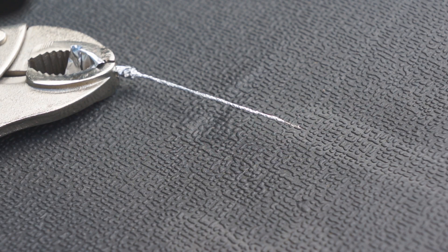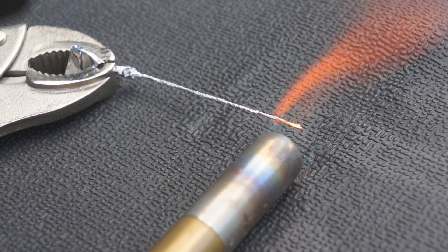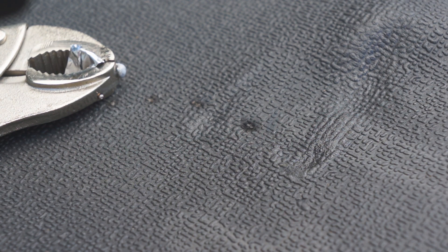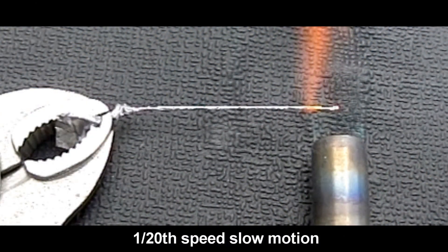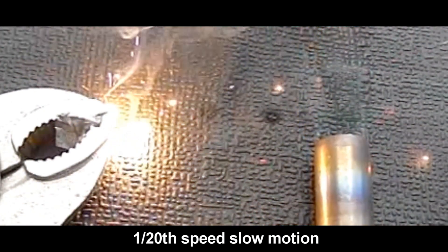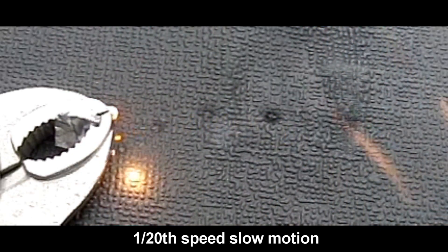Heat the end. So nothing too dramatic, you say — but you have to appreciate that this is just a mixture of two metals. It's not a fuel-oxidiser mixture like in pyrotechnics, but a simple intermetallic alloying reaction.